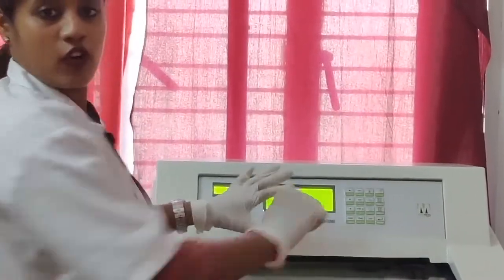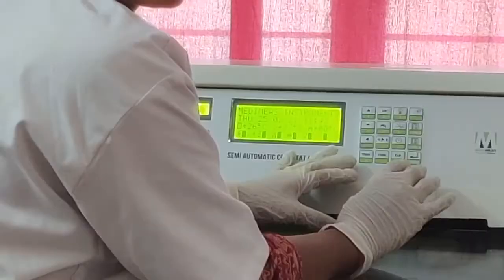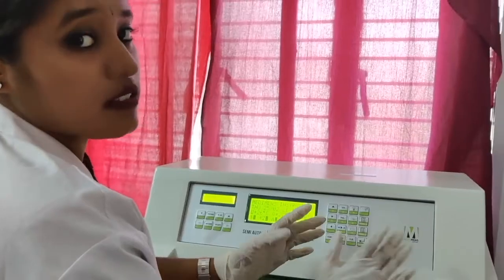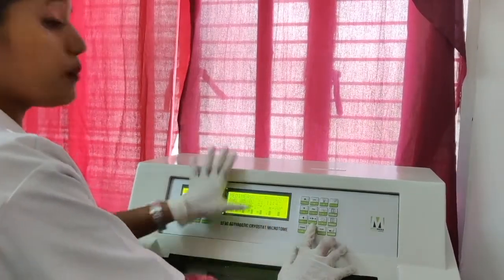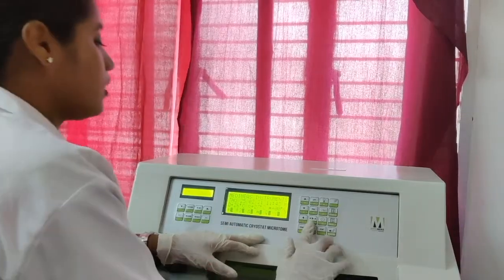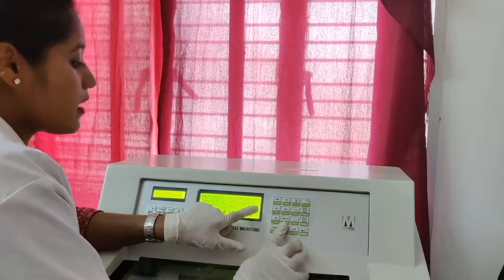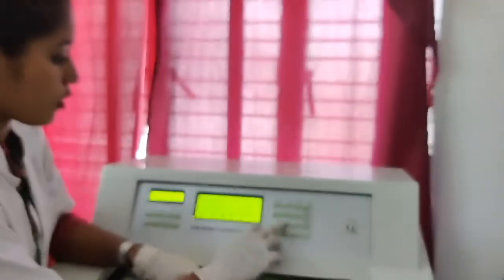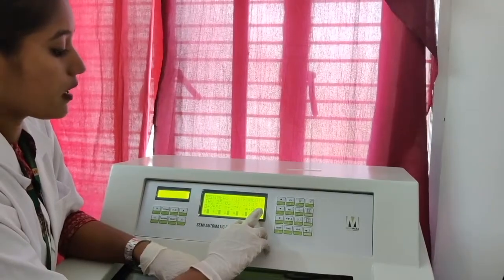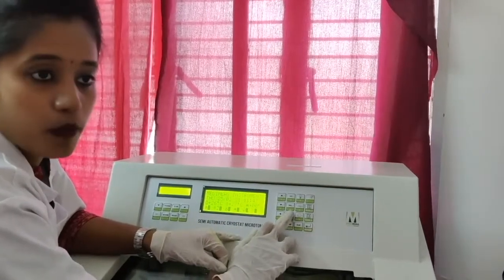Now moving on to how to set the temperature in the control panel. To change the temperature or the time, the equipment should be in the manual mode. Now I am converting, you can see here, if the M is there, it is manual mode. If I press this M automatic key, it will turn to automatic. You can see the automatic. In order to change or save the settings, you have to turn it into the manual mode.